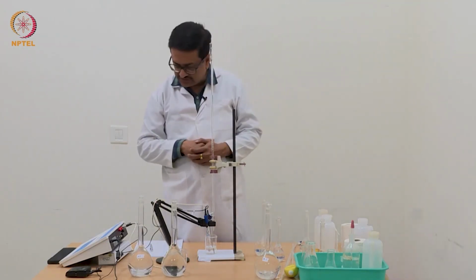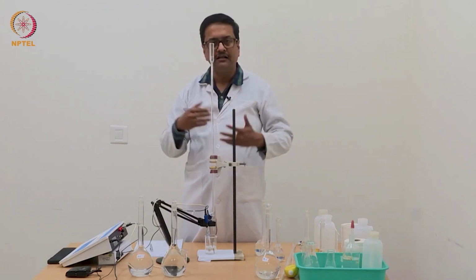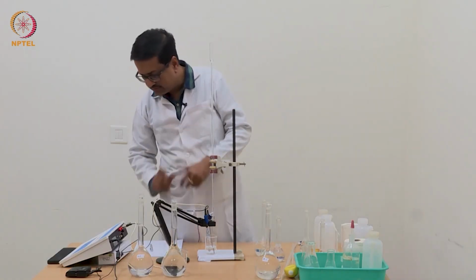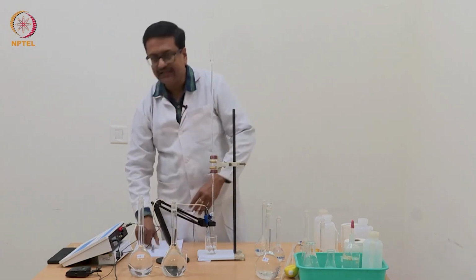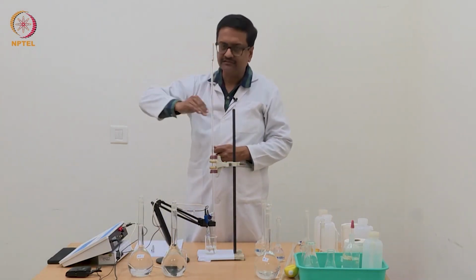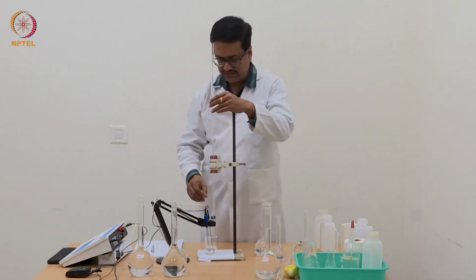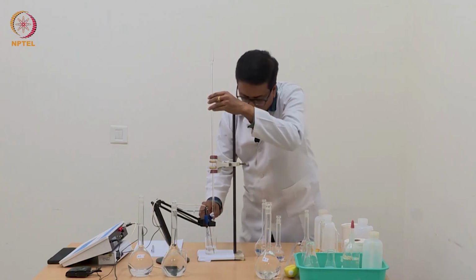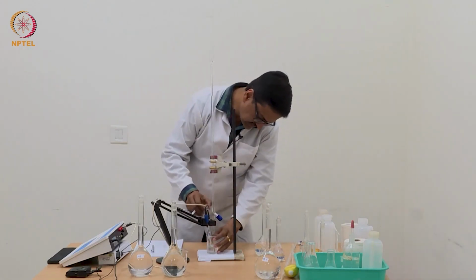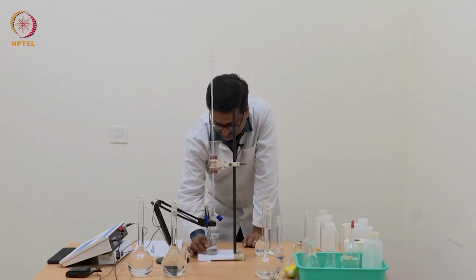Now, by stepwise addition, I have reached a point where I have added 1.30 ml and the pH reads 5.38, which now indicates that the S type of curve has started going upwards. So, to draw the curve very nicely, one should have readings with very small difference in the volume of NaOH added. That is, we should now use again 0.02 ml steps at a time.